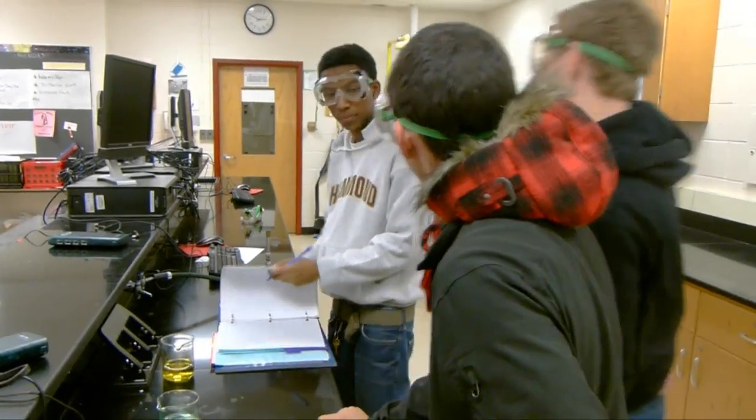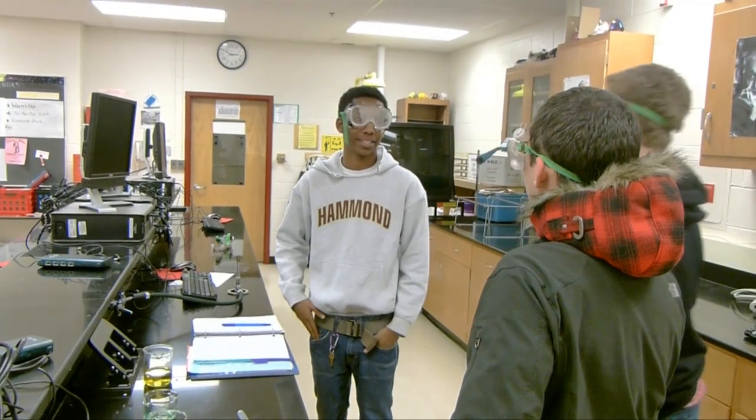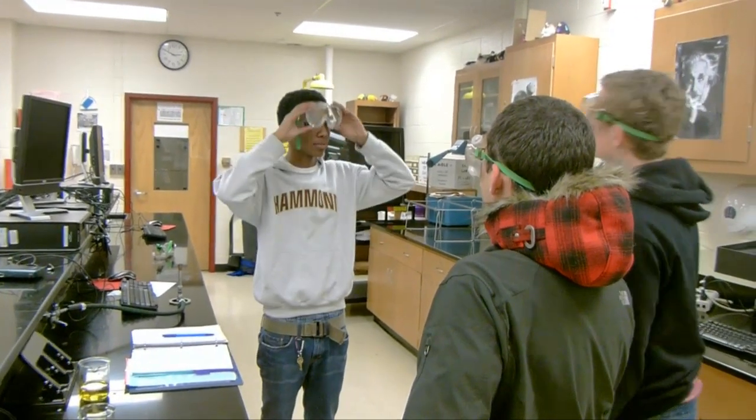Yo, Adam, bet you won't take your goggles off. Why would I? You won't. You will not take your goggles off. Robbie, I don't care. It's just goggles. You will not. You want me to do it? Yes, do it. It's goggles.